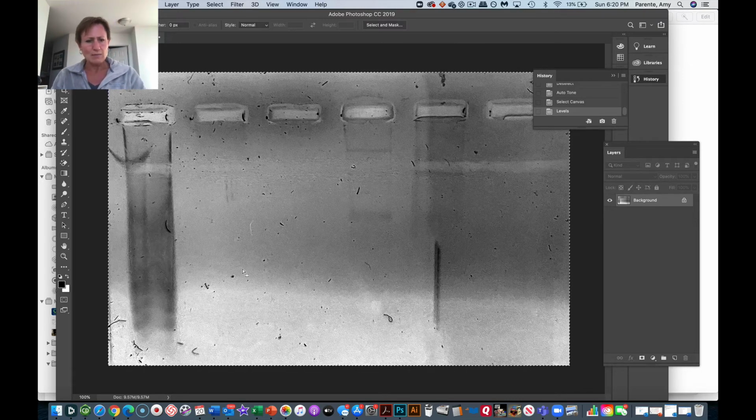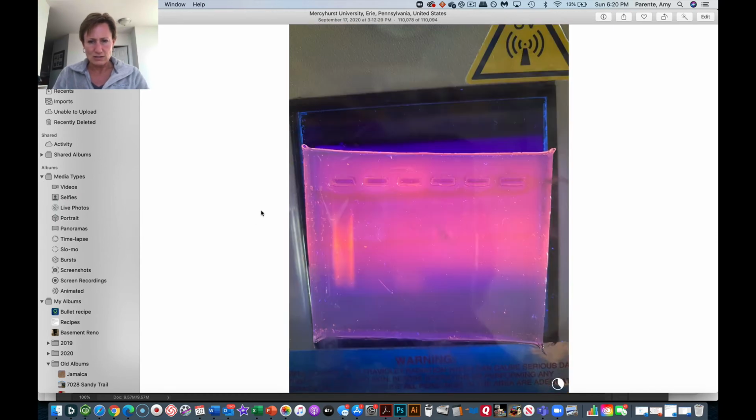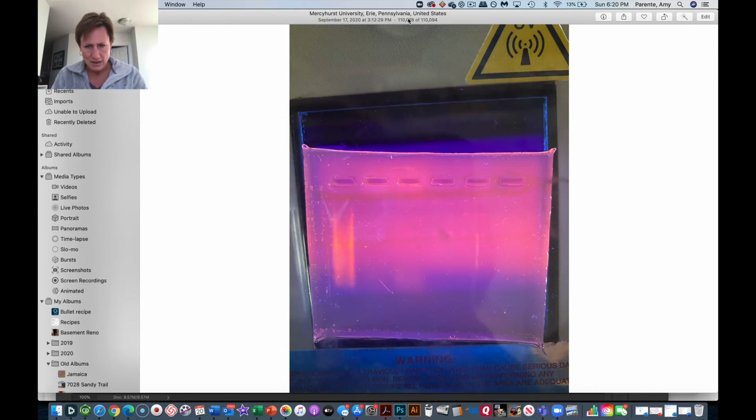So this one actually maybe wasn't the best gel. Let me see if I can go back here and look at some other ones. So this one here, you can see better, maybe this is a better gel to take. I'm going to take this one. And we'll actually go real quick through the whole process again, just so you can see it. I'm going to export this to this same folder. What I like about this one is we can see a little bit better the bands there that are degraded RNA bands.